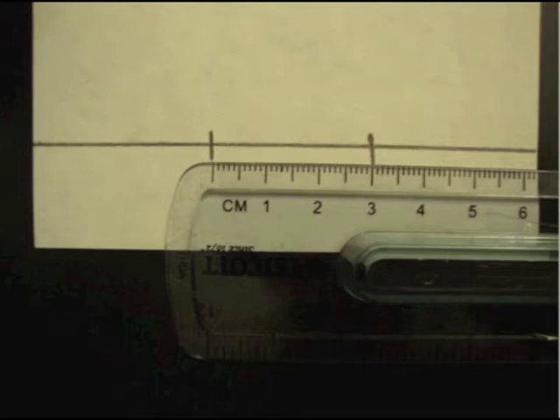For now, let's get started. Obtain two pieces of chromatography paper and draw a line two centimeters from the bottom on each. Be sure to use a pencil as pen will run during the experiment. Measure two points that are about three centimeters away from each other on each paper. Label each mark as one of the known four dyes.